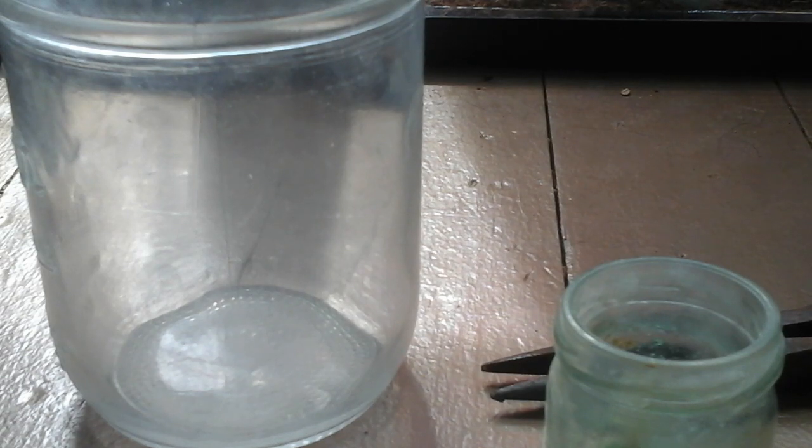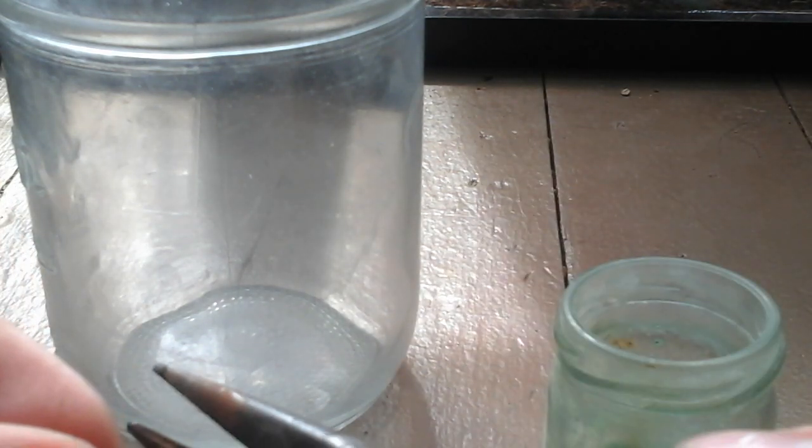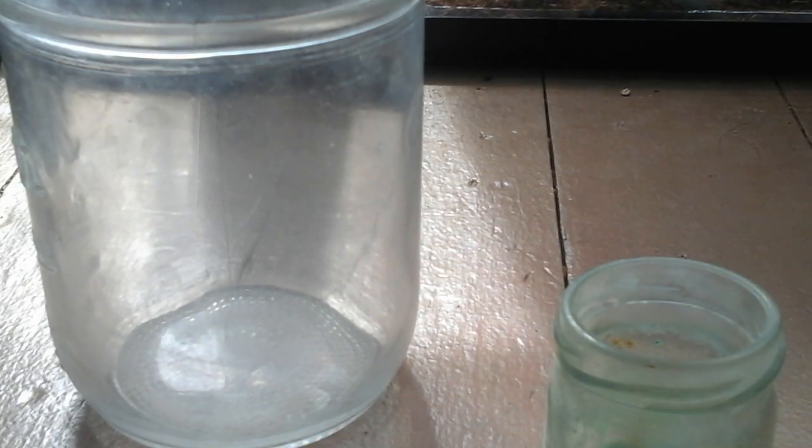So I'm going to actually cut the copper with these pliers into this jar — there it is in the jar — and this jar has nothing in it. Sticking my hand in it, there's no hydrogen peroxide.